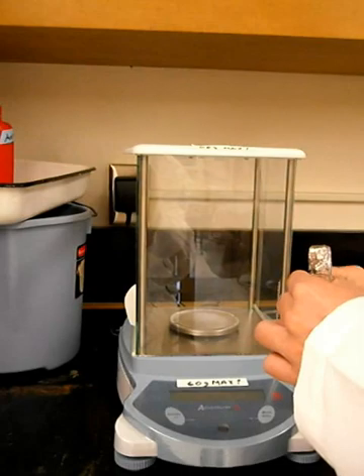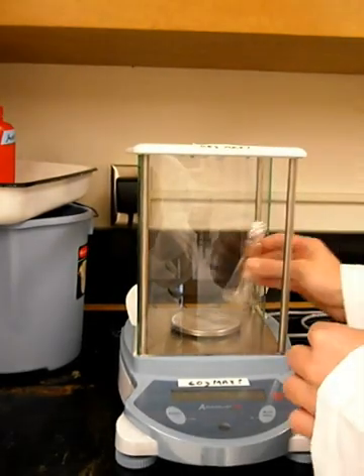Use a sensitive balance to measure the mass of the test tube and foil.